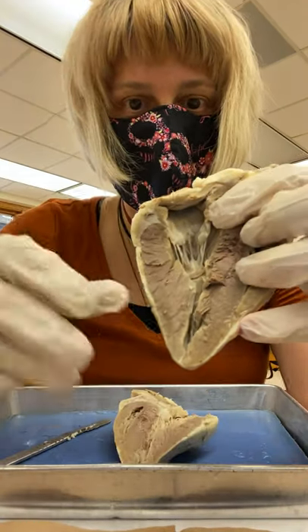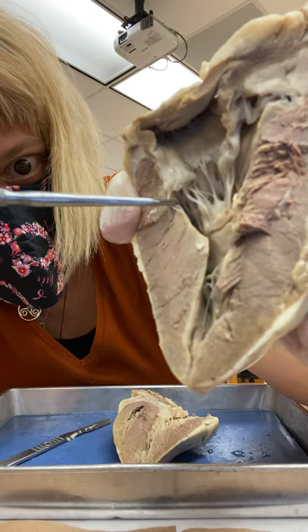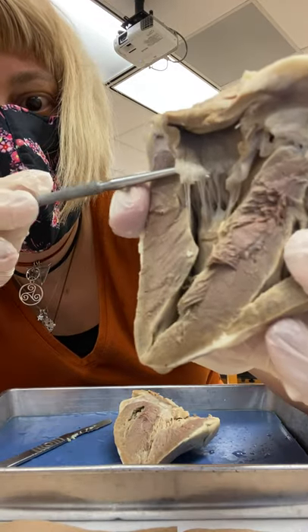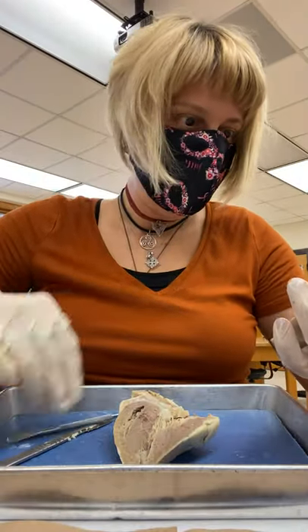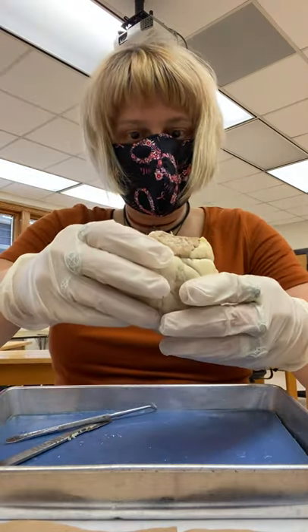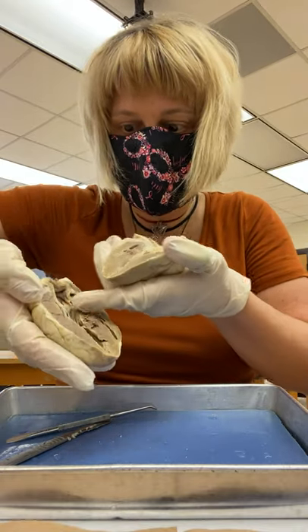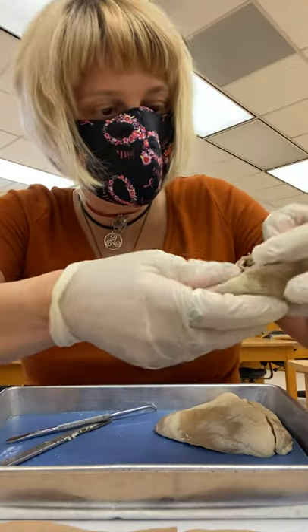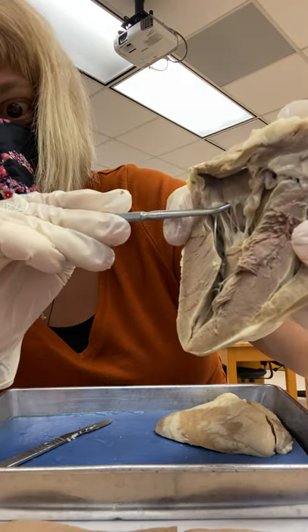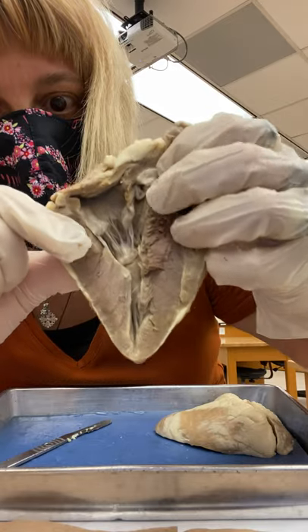So what you see here — there's the chordae tendineae, they're pretty strong, and what's left of the valve. If I put this back together and I want to know: is it the right or the left? How do I know? This originally was on this side, so that's your bicuspid. It's easy to identify because it really does have two openings — one, two. It's also known as the mitral.